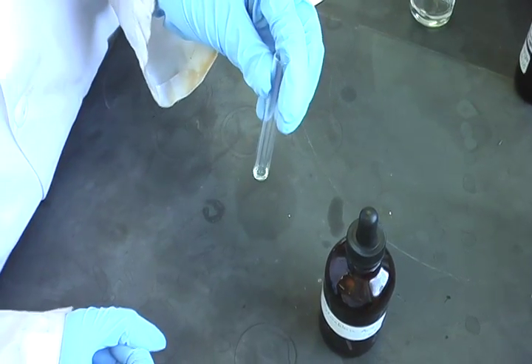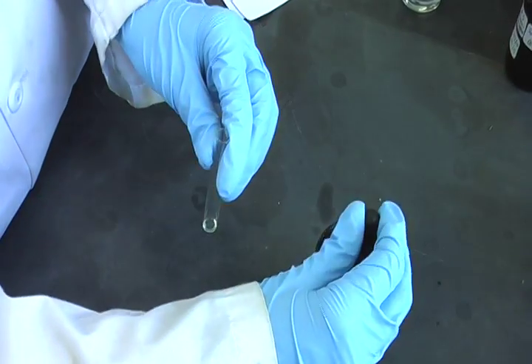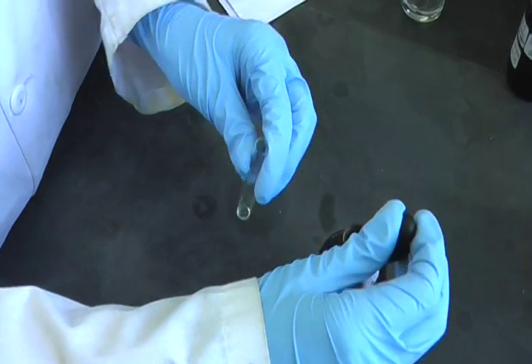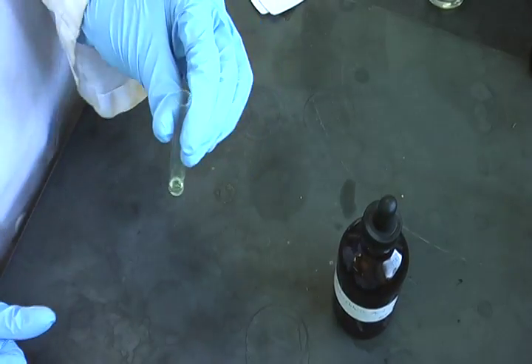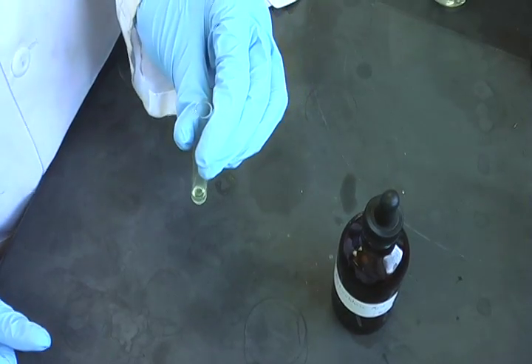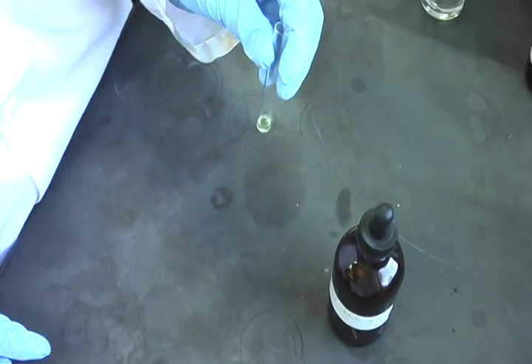After shaking for 30 seconds, the concentrated hydrochloric acid is added. Hydrochloric acid is added to protonate the mixture and drive the condensation reaction, acting as a catalyst.